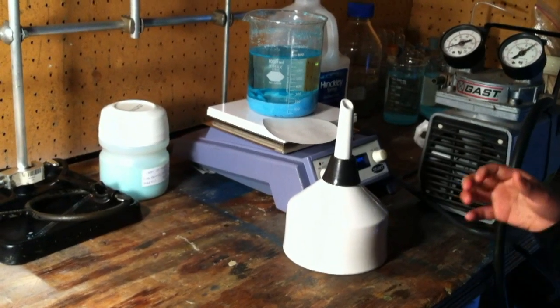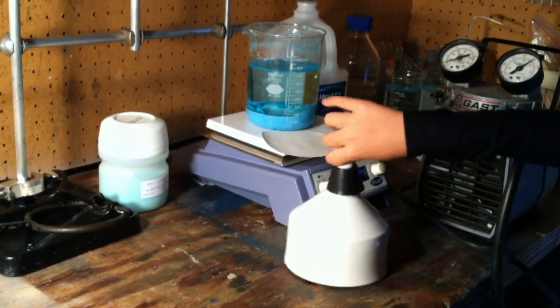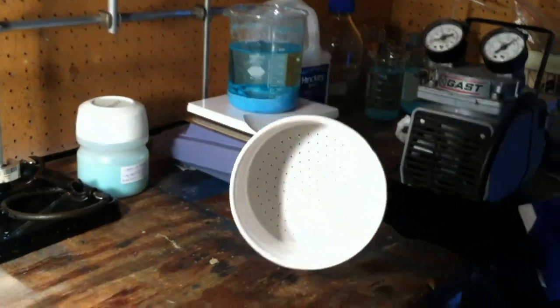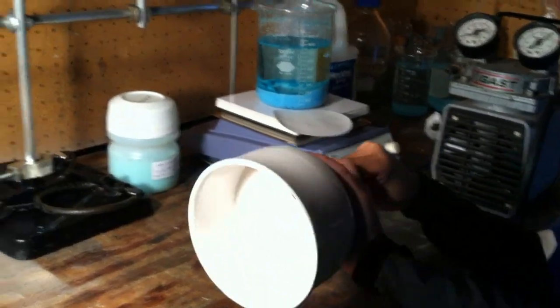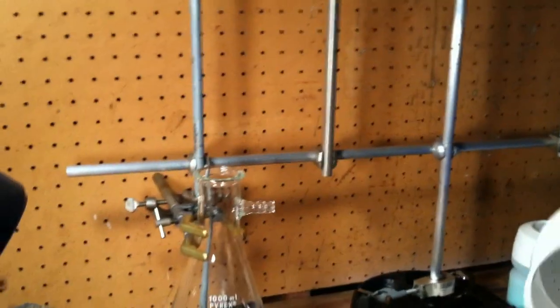You will also need a Buchner funnel. Here is a Buchner funnel. It has a lot of little holes. Attach the Buchner funnel to the vacuum flask.